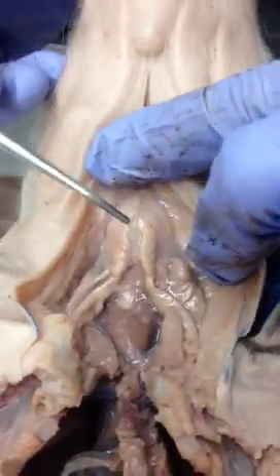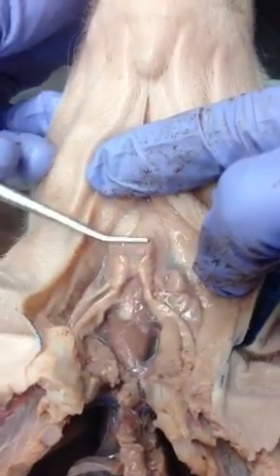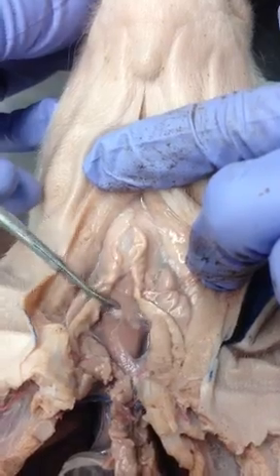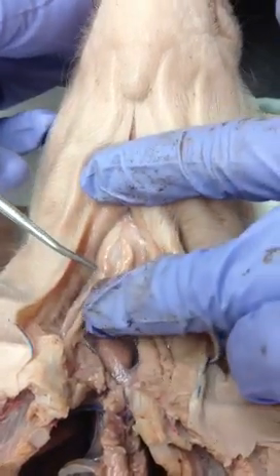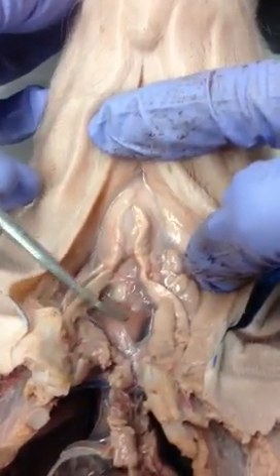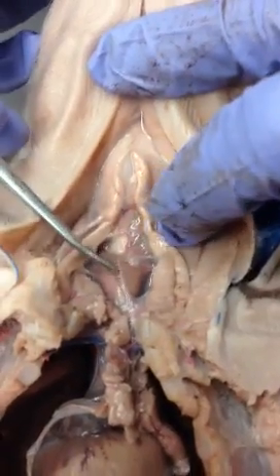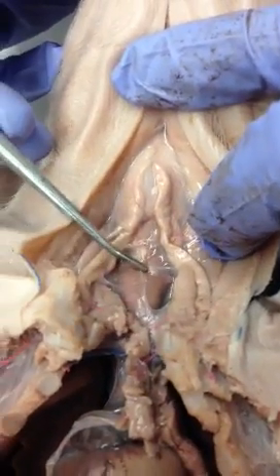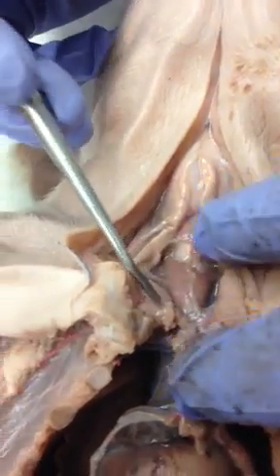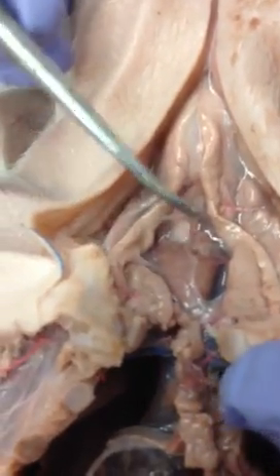This here is the larynx — it's hard. Kind of underneath the larynx is the trachea. This dark-colored part is the thyroid, and this brainy stuff is the thymus.